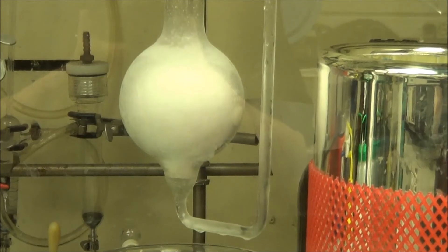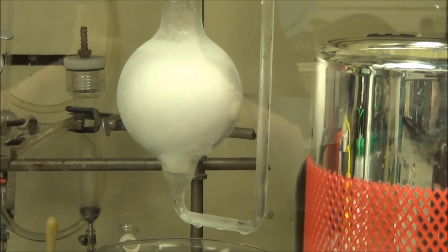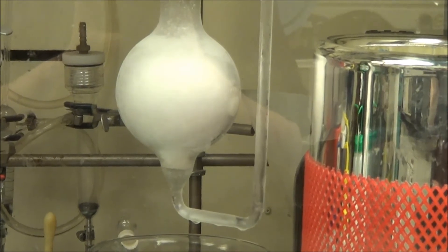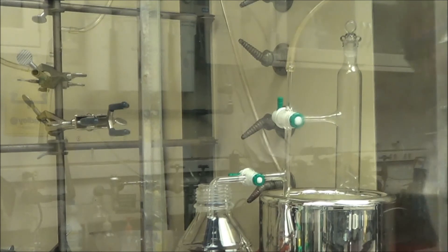Okay, we've done removing the acetonitrile and byproducts. Again, it did take a very long time. And you let it warm up. You're going to add, you're going to recharge it with acetonitrile, recrystallize it while bubbling. The exact same procedure. But what I want to show you is this.